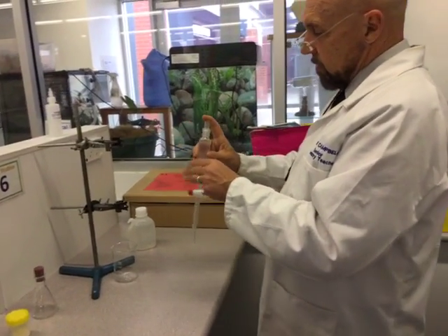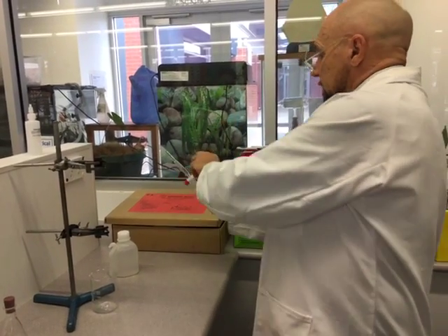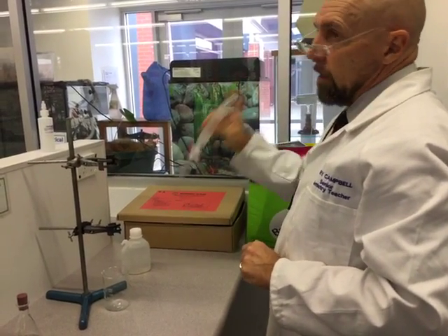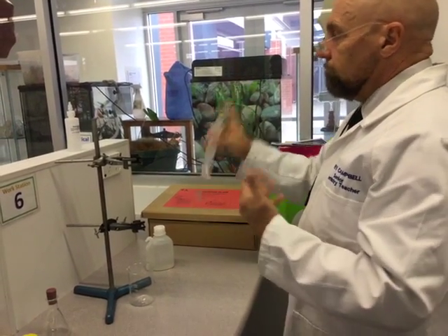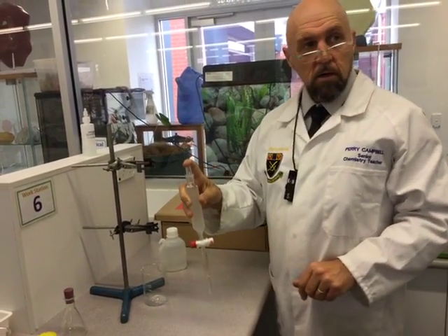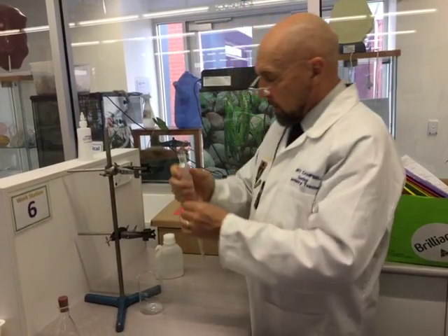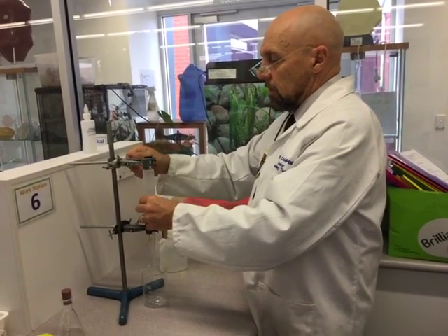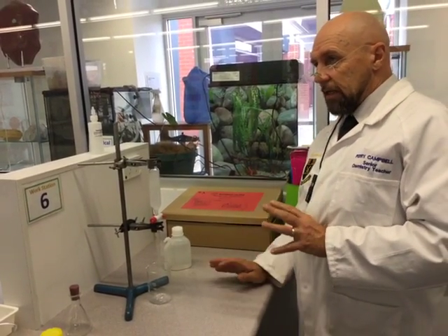If you watch here, this will definitely go — did you hear that? So there's definitely unreacted acid in there. I've probably got rid of most of that — I've now turned it into a soluble carbonate and carbon dioxide, so I think I've got rid of all that. I could go back and do a double extraction, but what's the problem with doing a double extraction? Time. And you might lose product. Each time I do the extraction I'm going to lose some product. If it was marks awarded to product, or if this stuff was really hard to isolate, I'm not going to want to lose anything.